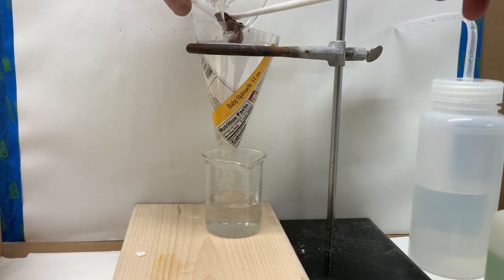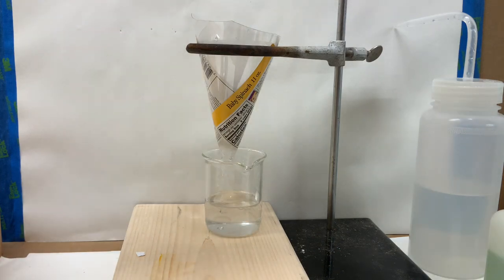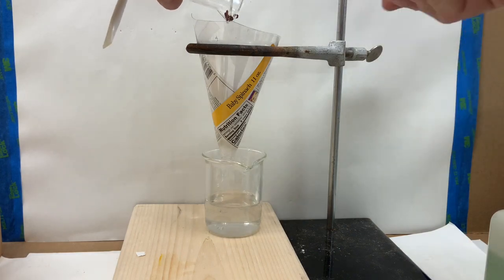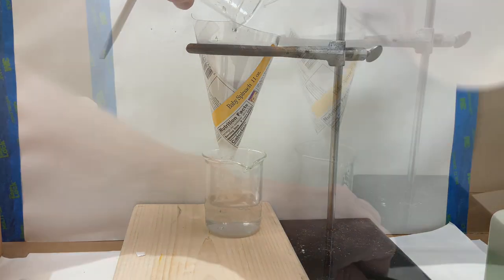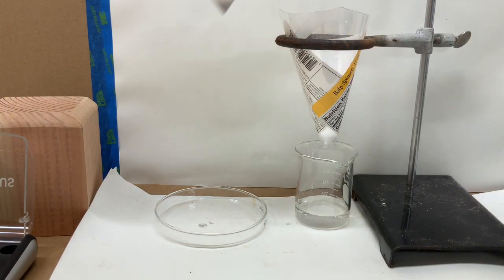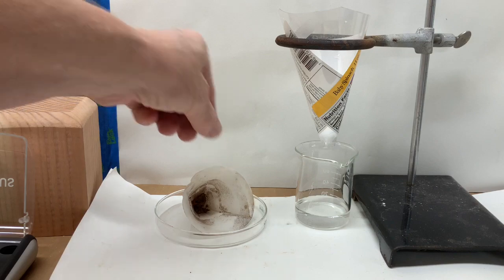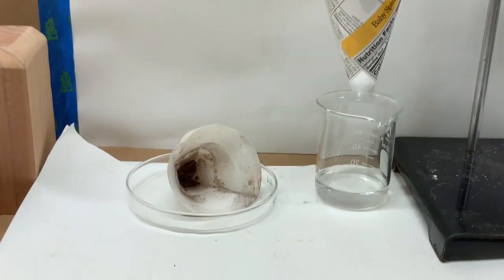Making sure that all of the copper makes it into the filter paper which has been weighed. The copper will then be rinsed to wash all of the copper from the beaker into the filter paper, and rinsed in the funnel to be sure that the solution has been washed off. Now the filter paper with the copper will be set aside and dried.